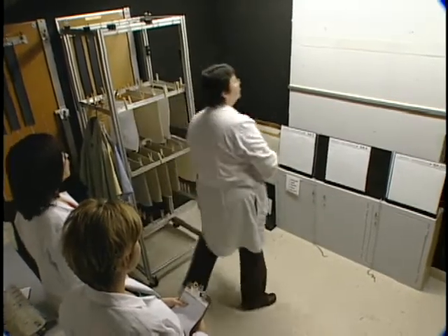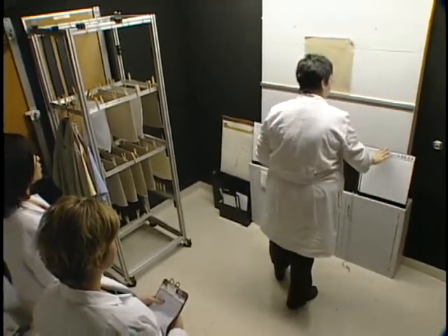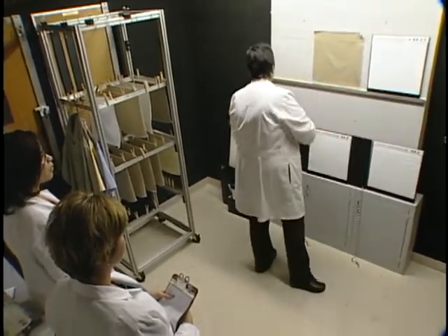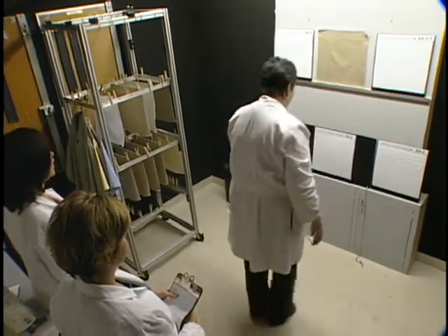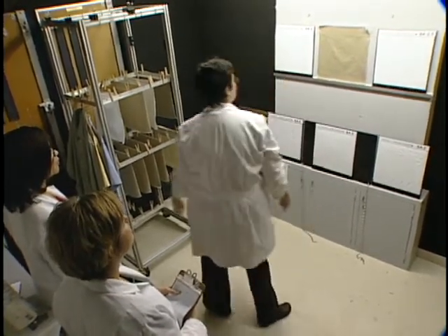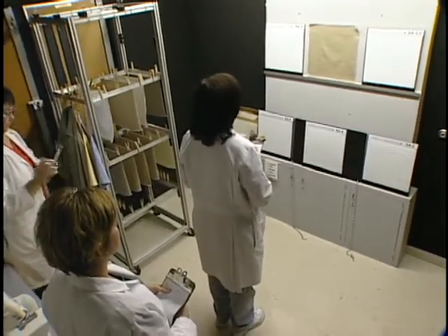AATCC Test Method Smoothness Appearance of Fabrics After Repeated Home Laundering is designed to allow for an appraisal of the smoothness of the fabric after at least three cycles. The test procedure is designed to reflect the capabilities of home laundry equipment currently used by consumers. It's preferable to conduct the test under relatively severe laundering conditions. Any washable fabric may be evaluated for smoothness appearance using this method.